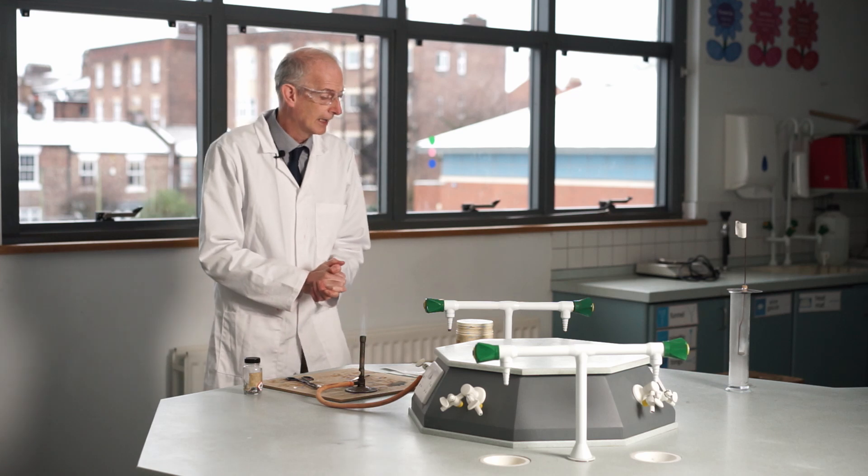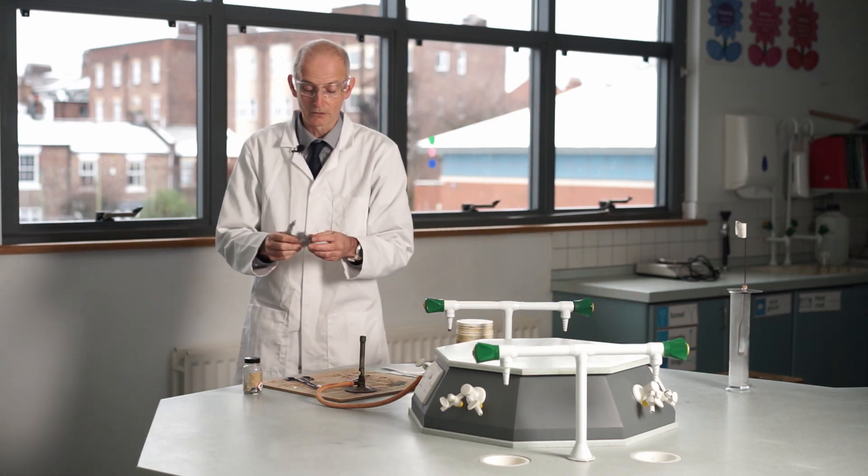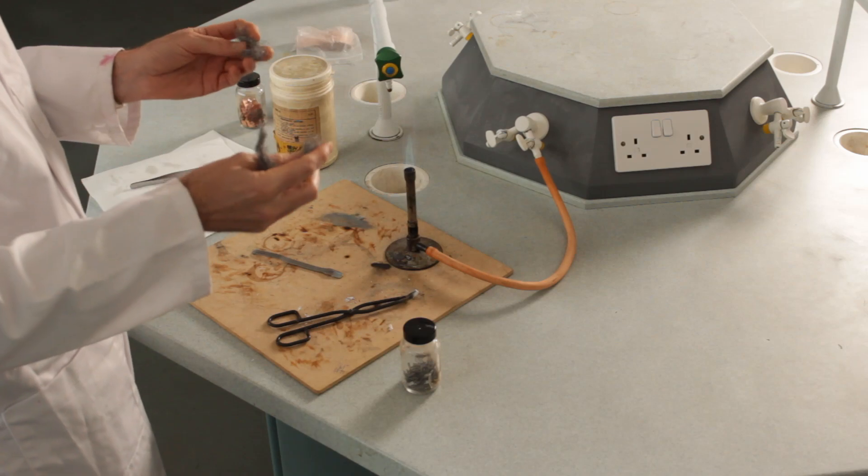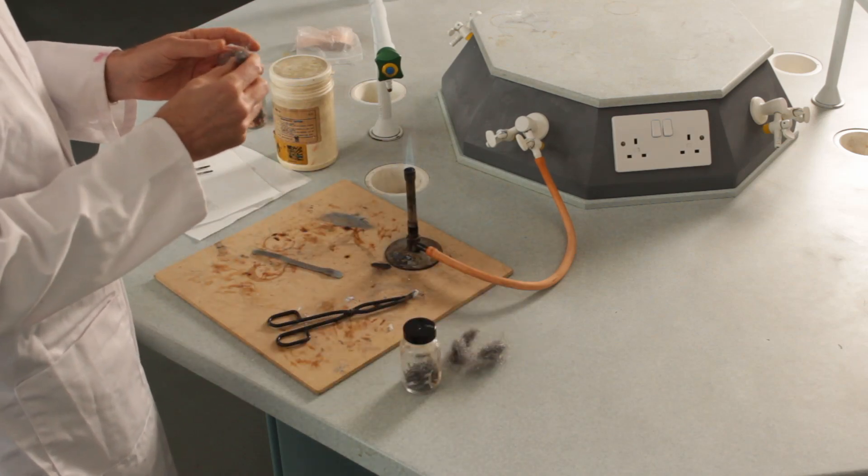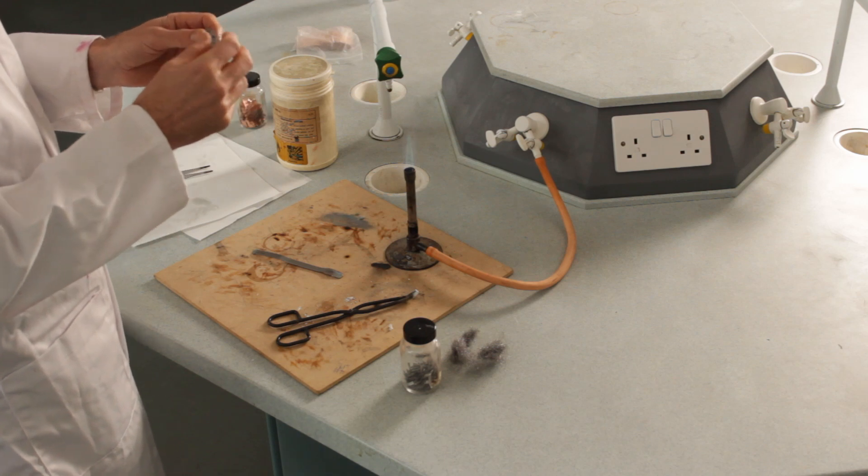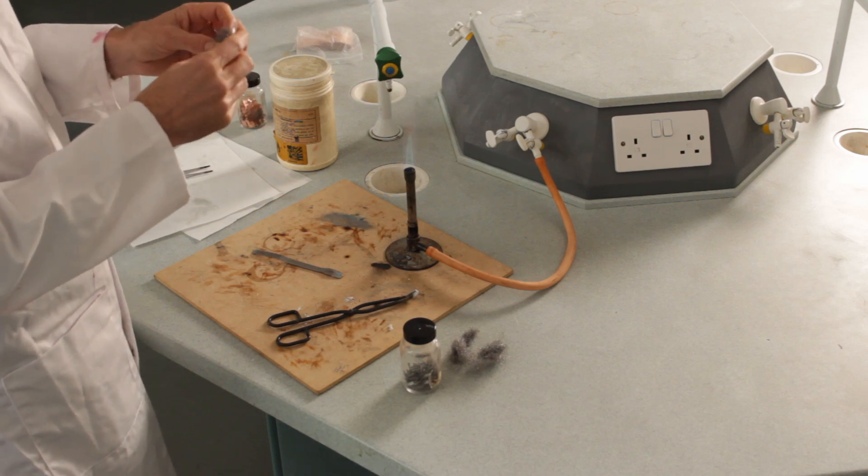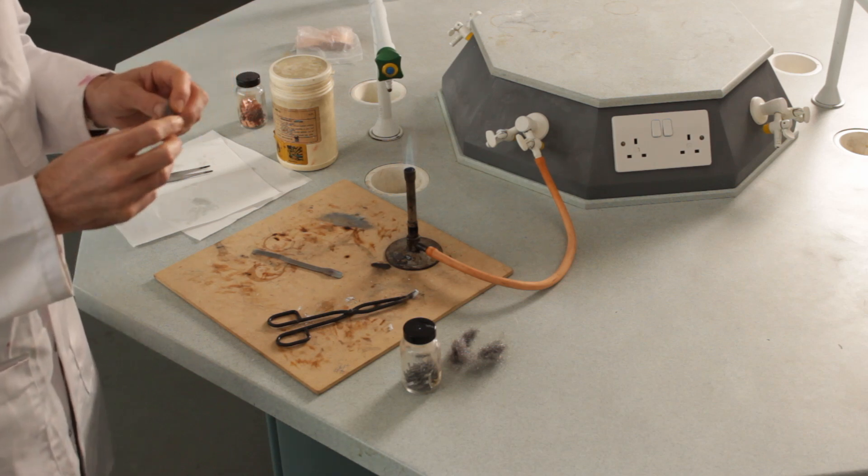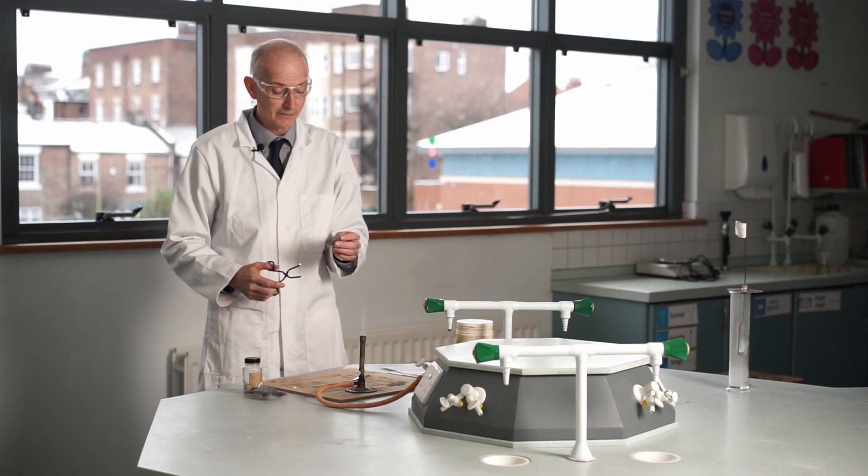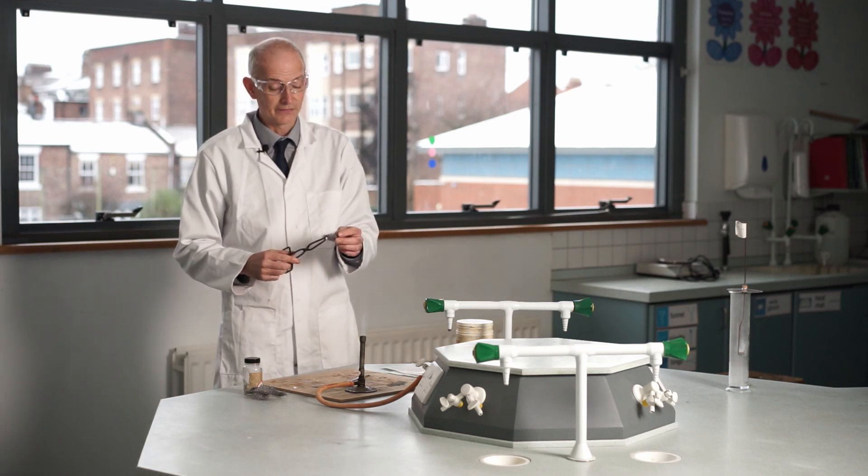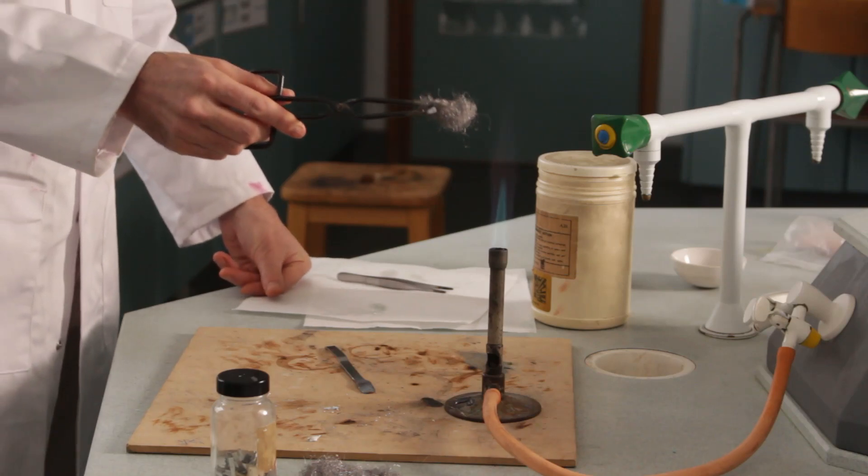We've done that. Let's look at this—this is iron. It doesn't look like iron. This is iron wool, the sort of thing you might get on scouring pads and stuff like that. Again, very finely drawn out fibers of iron, not like an iron nail or something like that. The reason I'm using this one is if you try and heat an iron nail it doesn't do very much. But as you can see from this gray hair-like substance, when I put it in the flame, watch this.